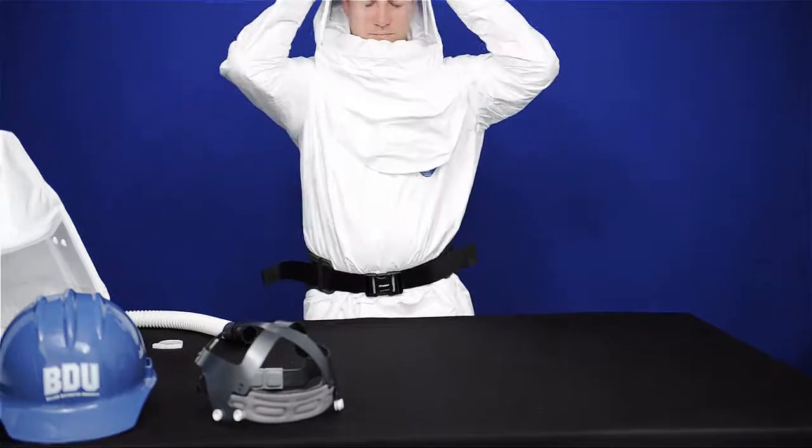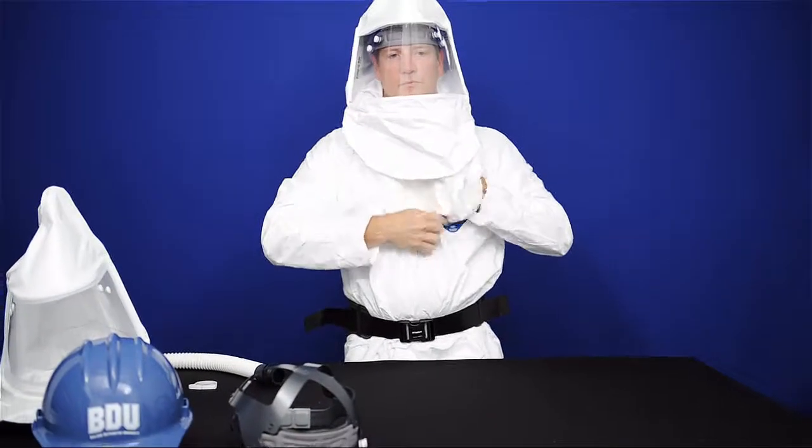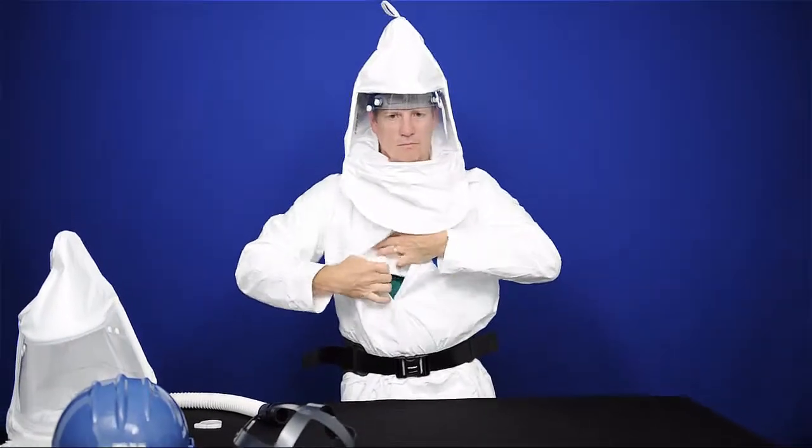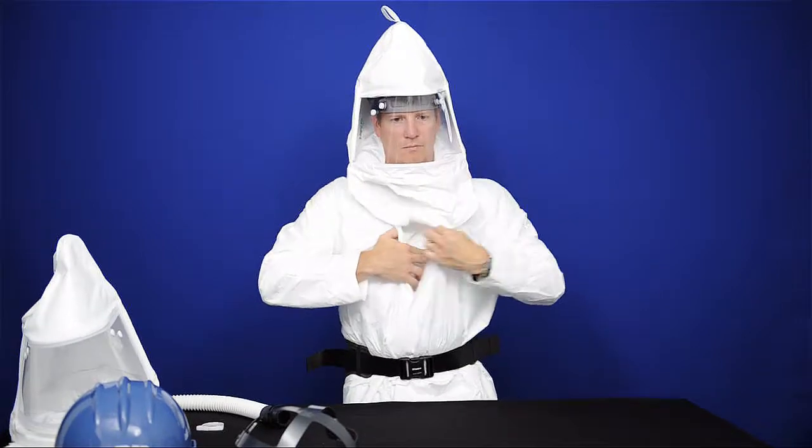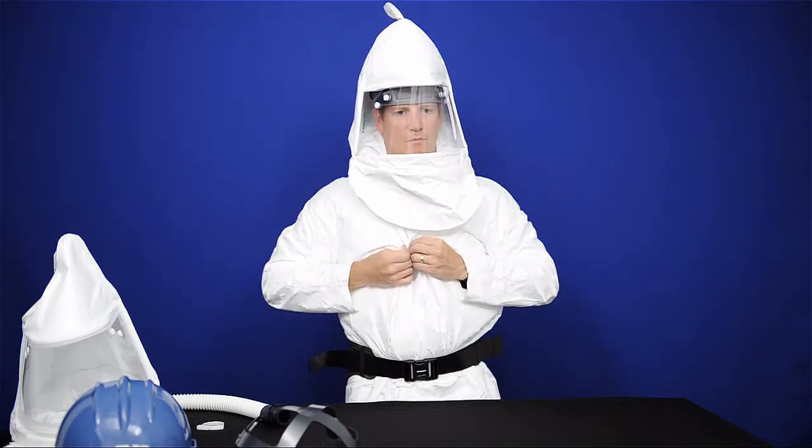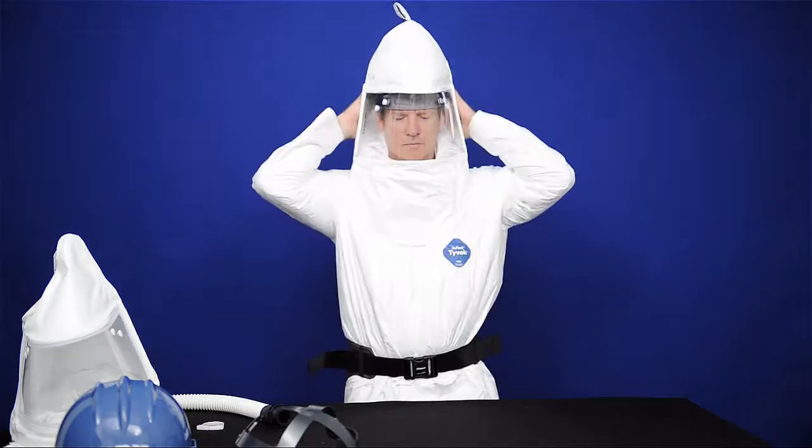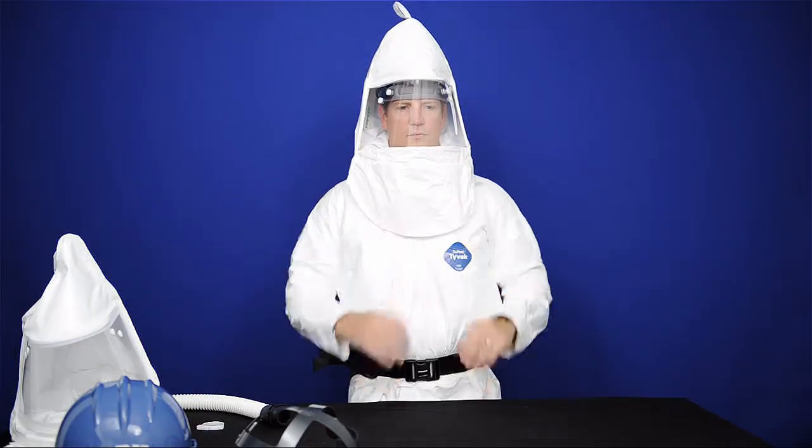If there is an inner bib, then tuck the bib into the shirt or coveralls. Pull the outer bib over your outer clothing. Ensure the neck cuff is below the chin and the air outlets of the cuff are not restricted.